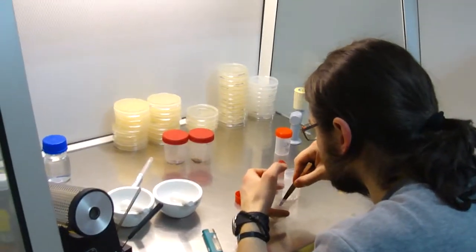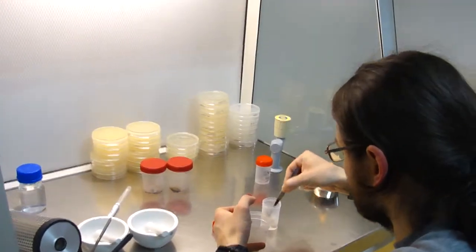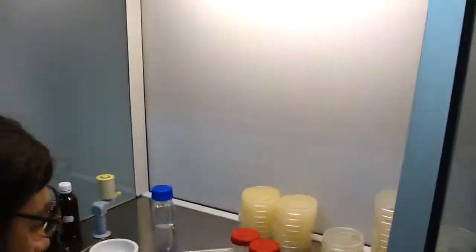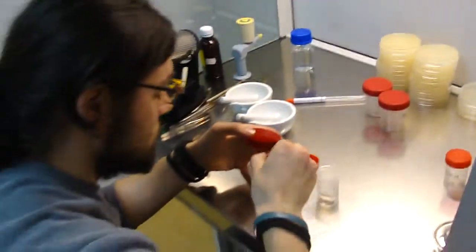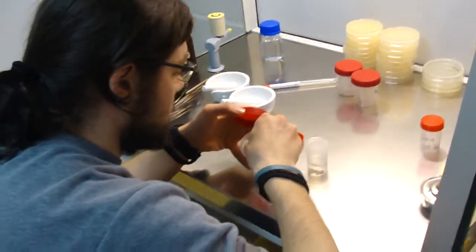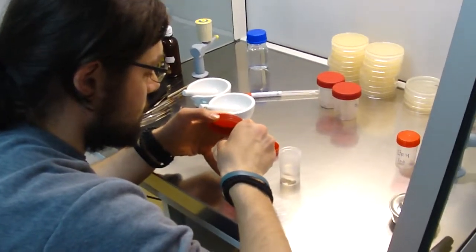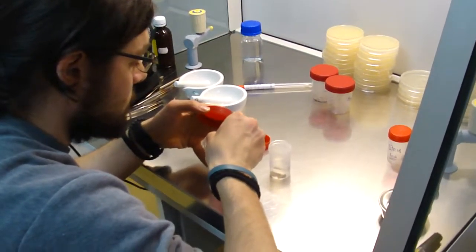First you need to transfer all of these pieces into your ethanol solution. If you like to keep some samples you can.